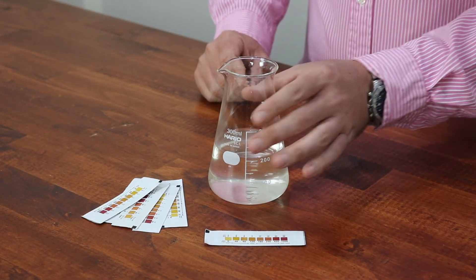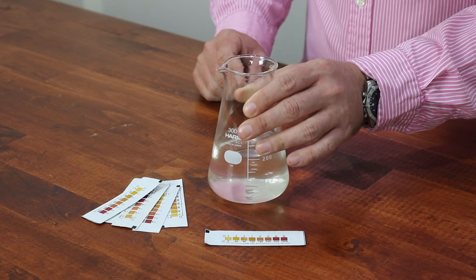To begin the testing you want to rinse the container out three or four times to make sure it's completely clear of all other contaminants.